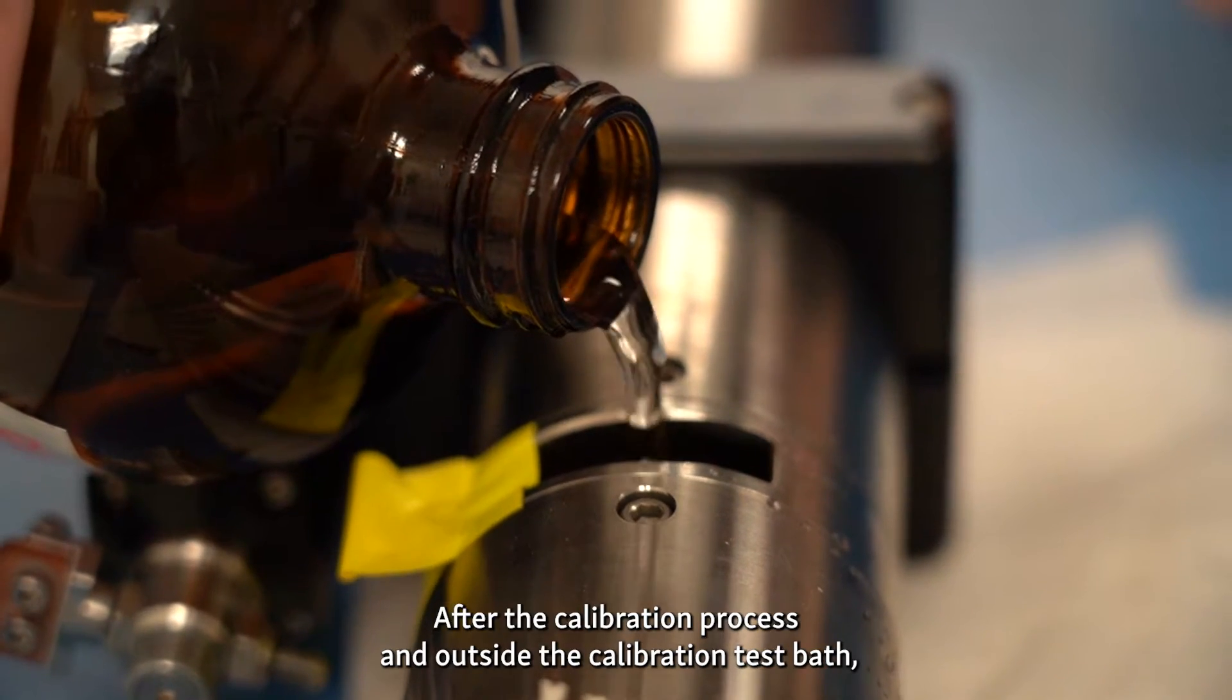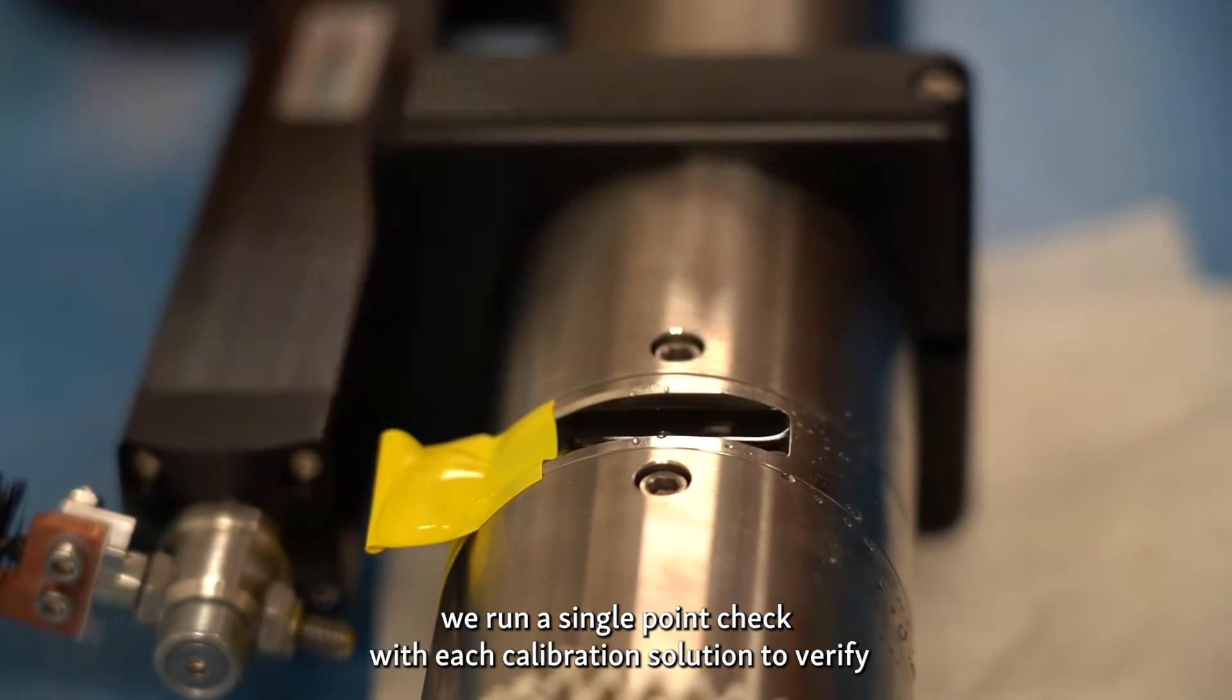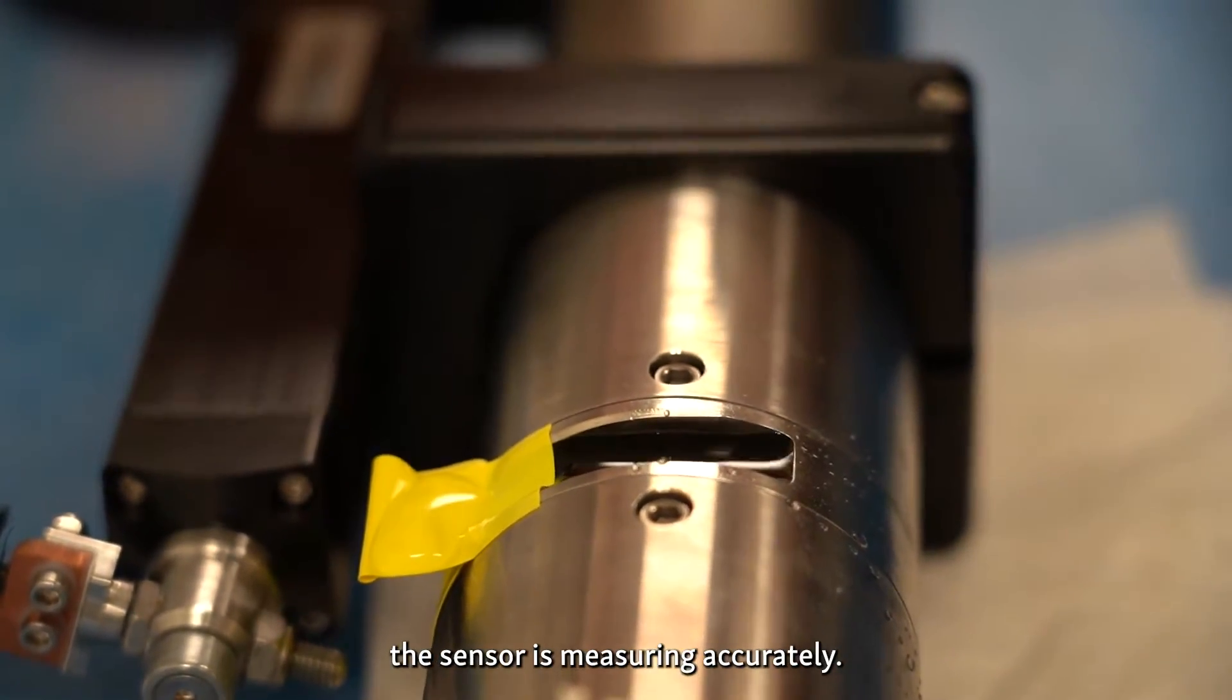After the calibration process and outside the calibration test bath, we run a single point check with each calibration solution to verify the sensor is measuring accurately.